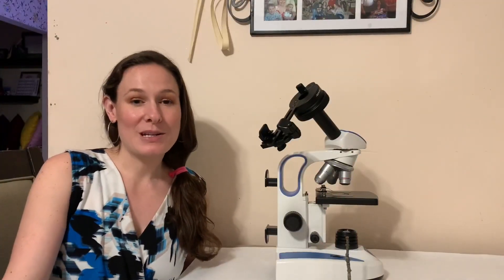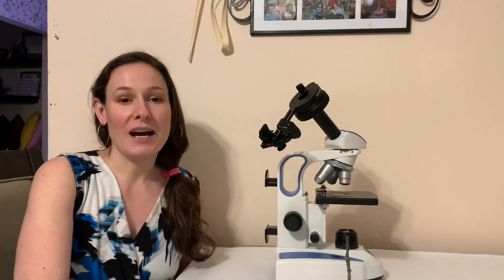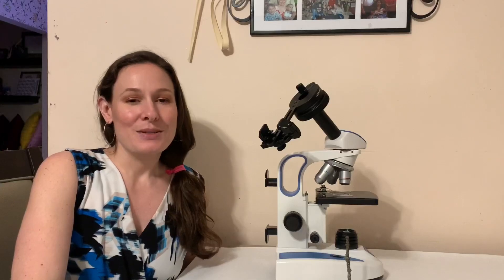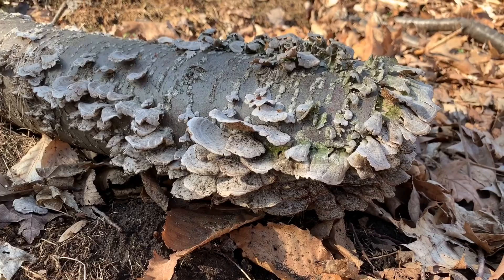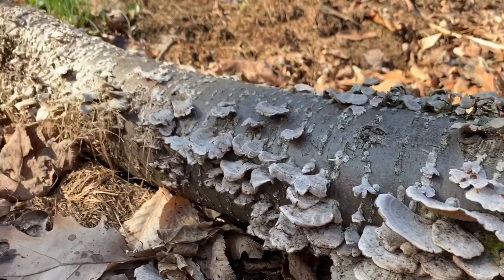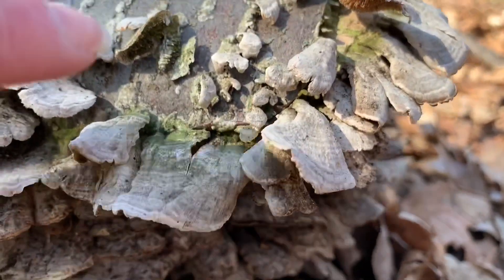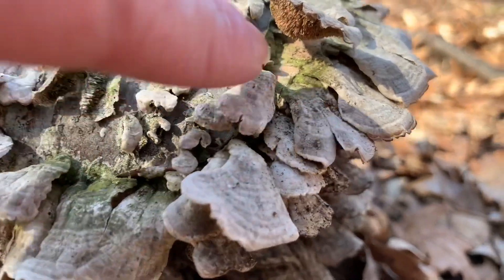Today we are going to go on a virtual adventure to find and observe lichen, so here we go. Now look at this beautiful sample of shelf fungus — if you look here you see the green. That green right there is lichen.